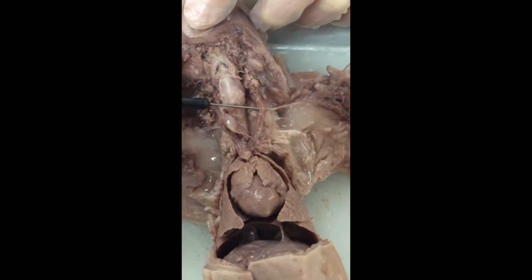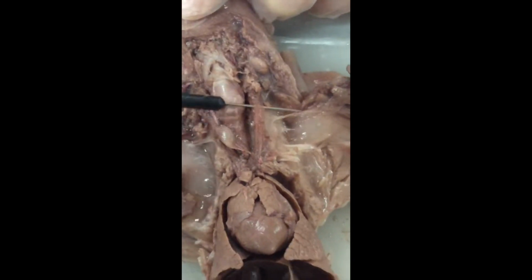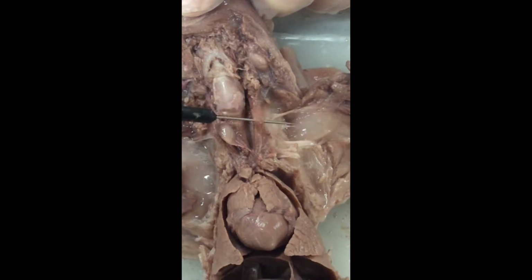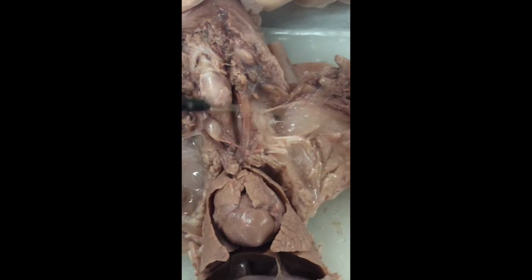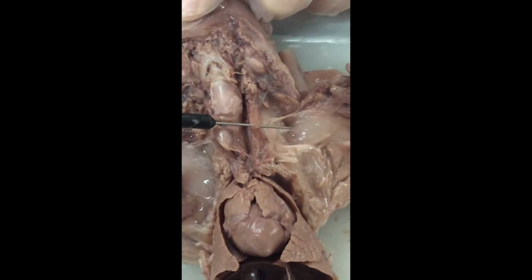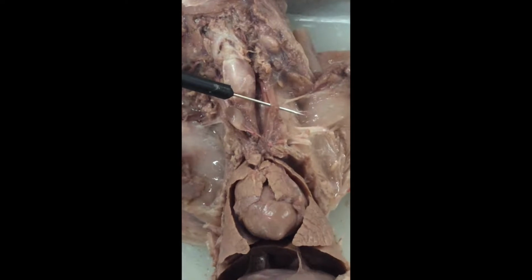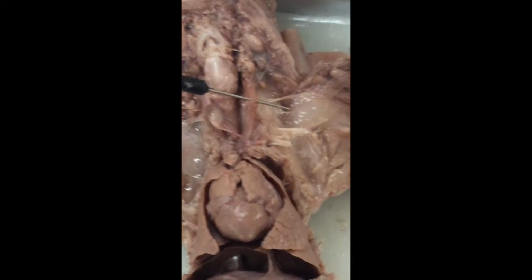Associated with each of those, you maybe can see that there is another blood vessel that is not filled with latex, and it's clearly much more flexible, not nearly as rigid or strong. This is a vein. This is the jugular vein, and again, using the terminology of left and right, this would be the left jugular vein.